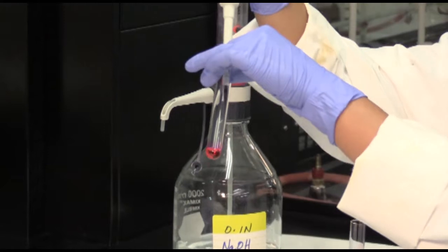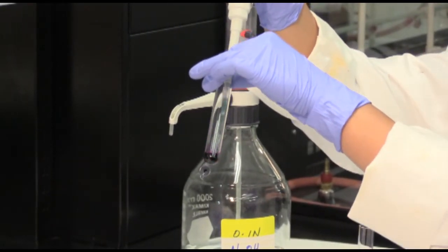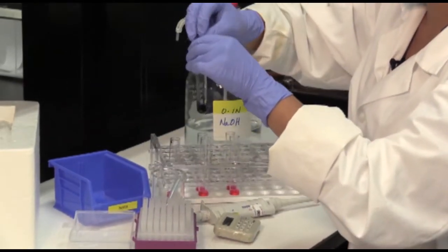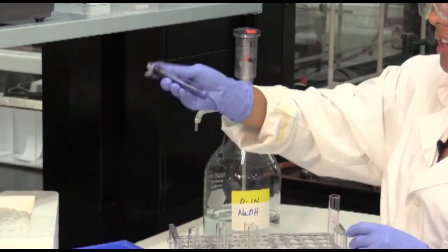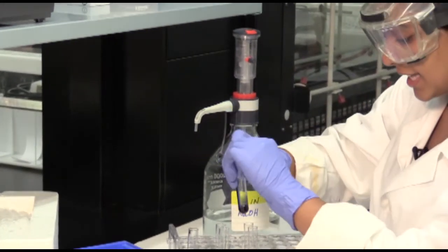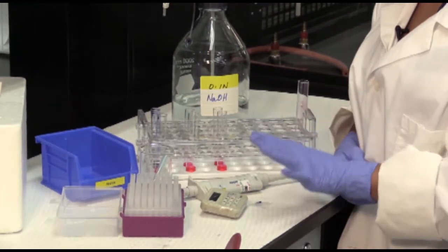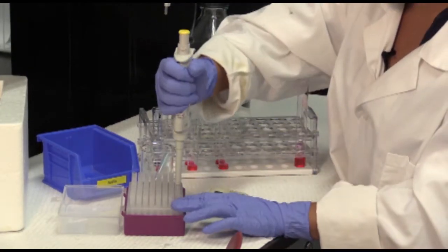We're going to insert the enzyme, get some parafilm, shake it by inversion, and now that that's done, you're going to start the timer. Wait for 30 seconds before you do this to the next test tube.